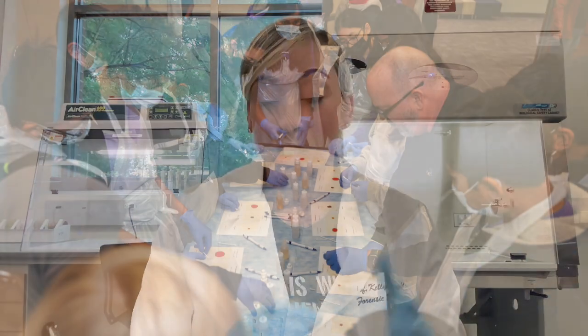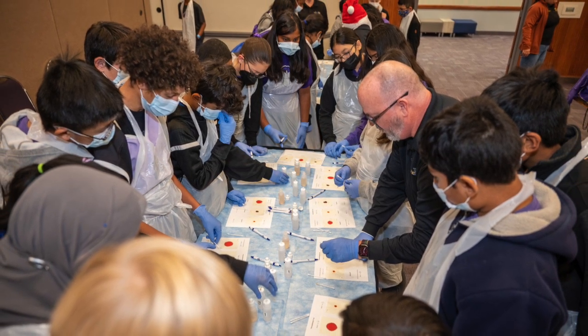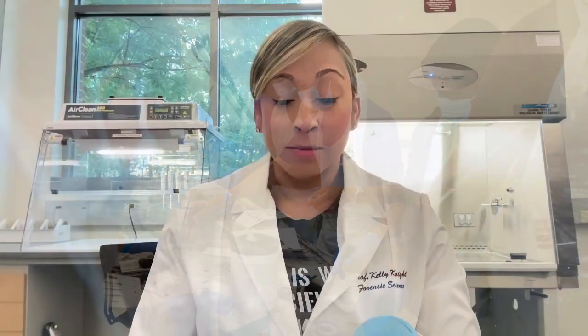Let's say we have our DNA evidence here and your students are ready to start their activity. They've opened up their evidence package from the crime scene or from a pre-packaged envelope, and you're going to do the test with them. Before this, you want to talk to them a little bit about forensic DNA and explain what these presumptive tests do and why we do them. One of the reasons why we like to do presumptive tests is because when you go to a crime scene and you see things that are red or brown, it's not always blood — it could be hot sauce, it could be ketchup, it could be barbecue sauce. No one wants to spend thousands of dollars doing DNA testing on barbecue sauce. So it's important for us as DNA analysts to know beforehand whether or not the presence of blood is indicated.